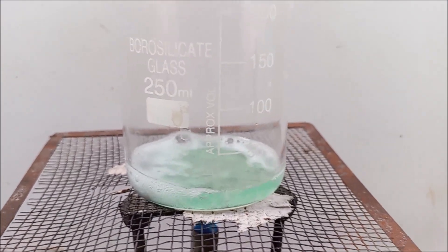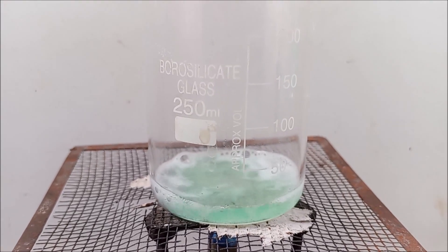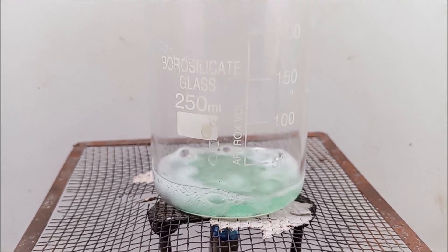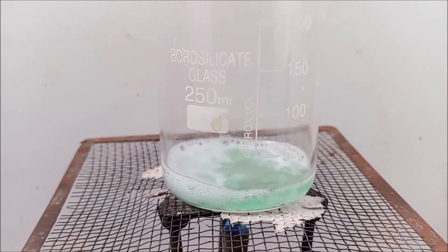On warming, the color darkens a bit. Do not boil the solution as it decomposes hydrogen peroxide completely. I have made this mistake, so I had to do it again.